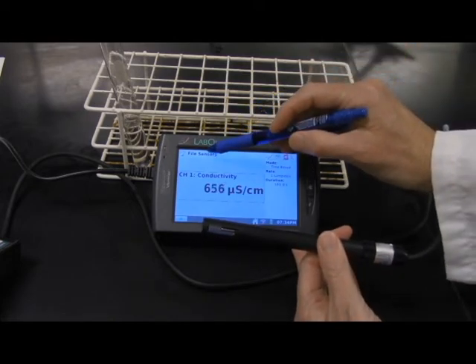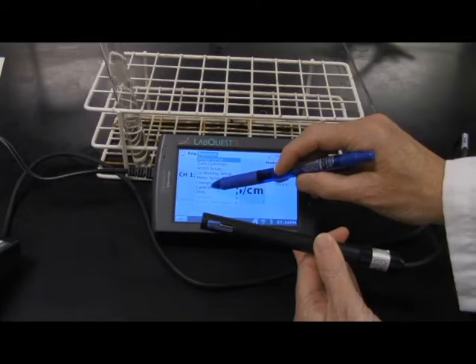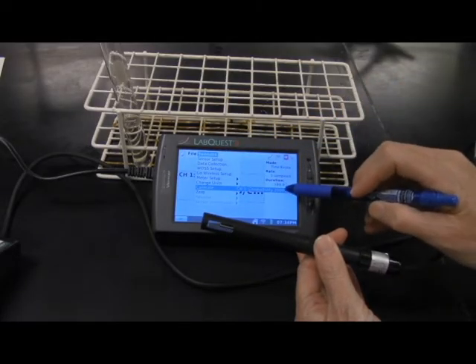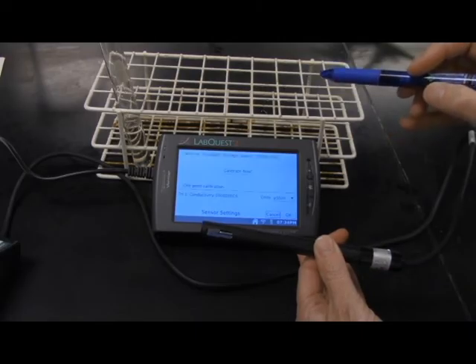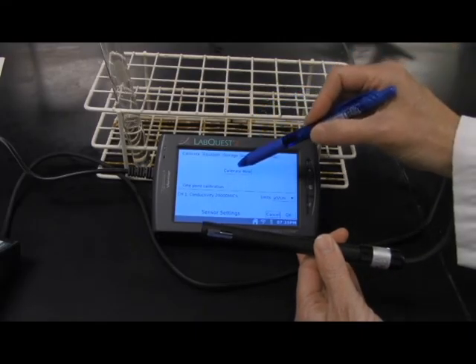You go to the sensors menu and you select calibrate. And it should be on the 20,000, 0 to 20,000 range. And we're going to calibrate now.